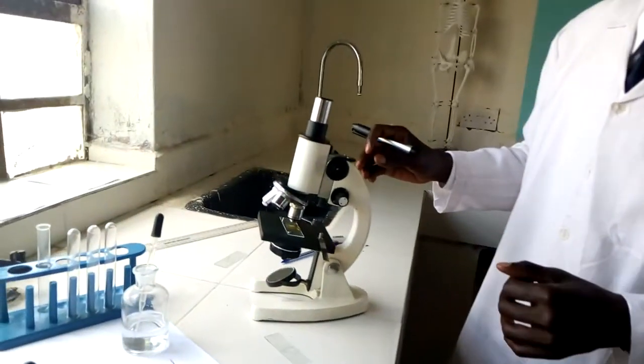I think you can still remember. In the fourth lesson, we are going to study how to estimate the cell size. I think you still remember that in our third lesson, we were able to make some onion epidermal cells, which I'm going to use in the fourth lesson to try and see how we can estimate the cell size. There we go. It is right here on the screen.